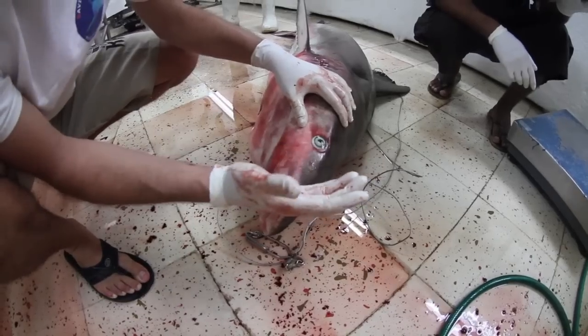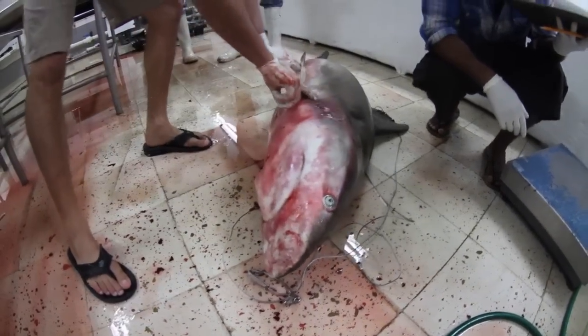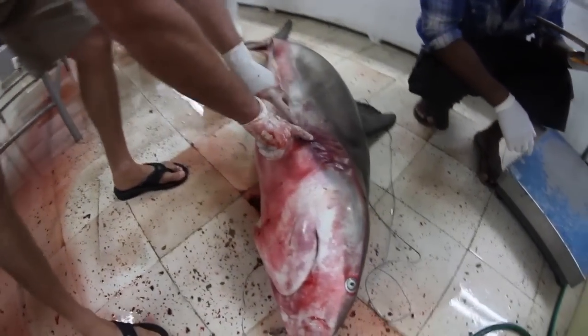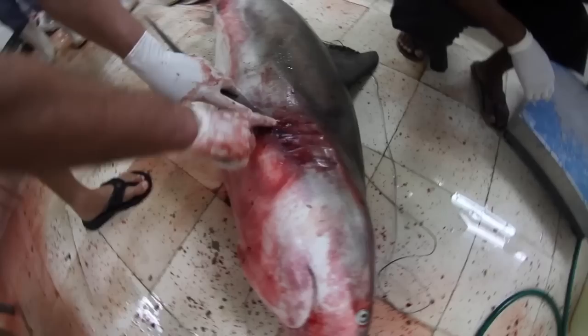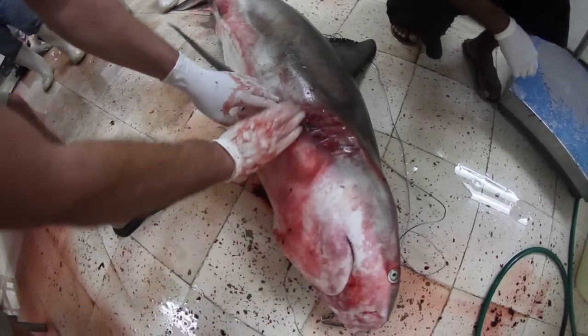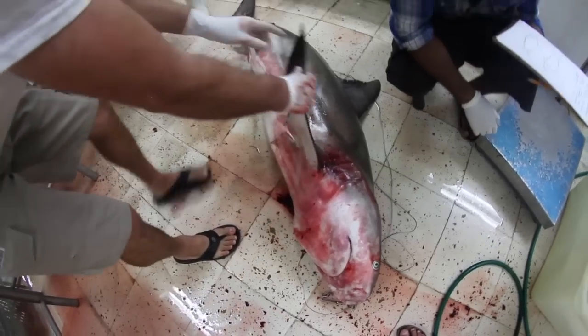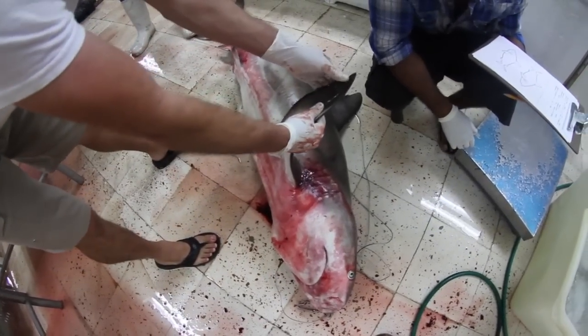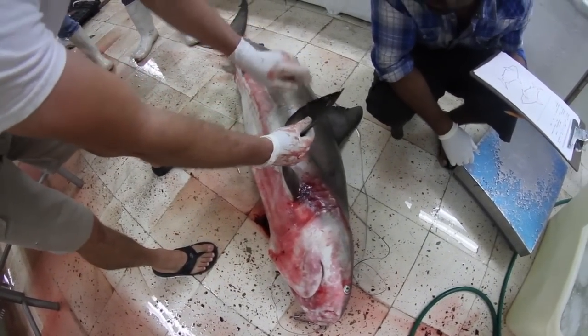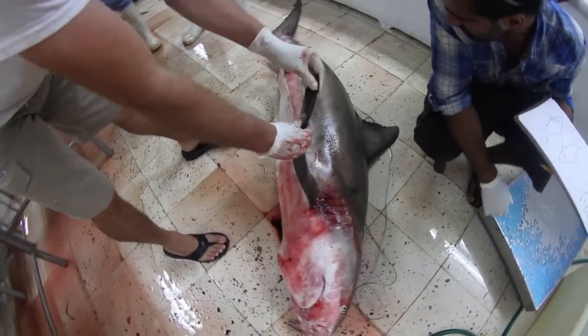The snout is moderately small. The last two branchial arches are at the base of the pectoral fins. The pectoral fins, as well as the first and second dorsal fins, are darker in color.